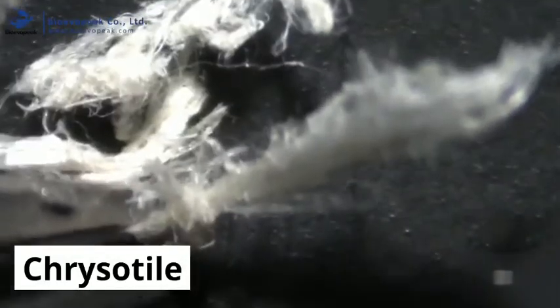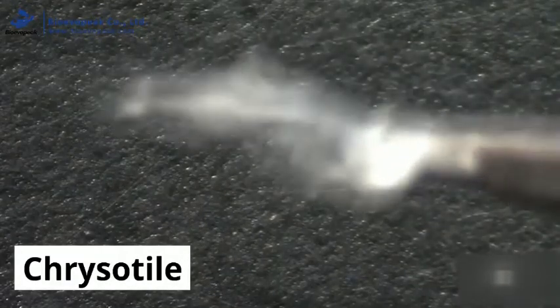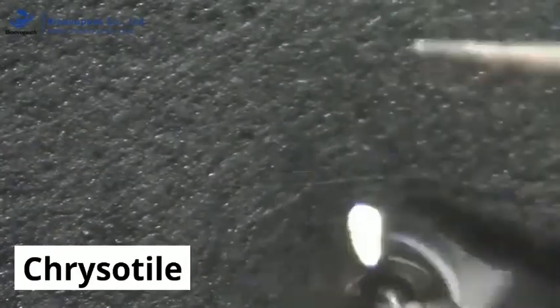Suspect fibres are then taken and mounted onto a microscope slide in a liquid which shares similar optical properties to that of chrysotile. In this case, a liquid with a refractive index of 1.550.